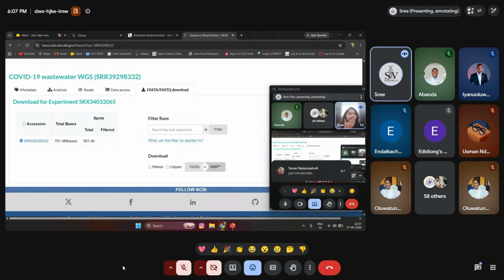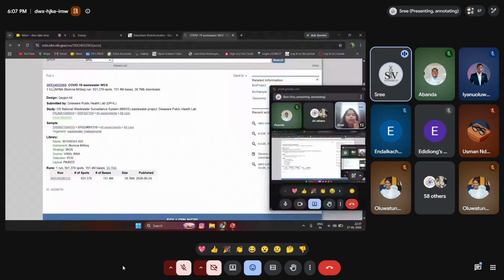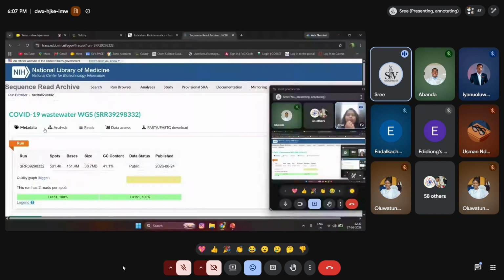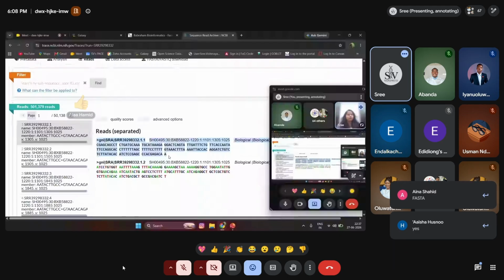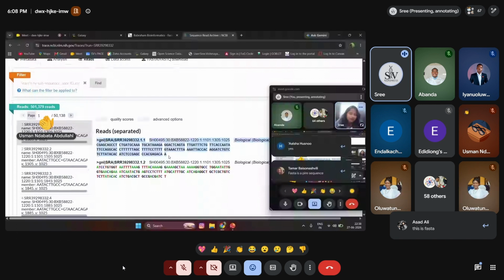This is how you need to check the data. I've just selected one sample, with its sample ID, which is the meta information. In download, this is called SRR. It is also called a sequence ID or accession ID. You can name it anything. If you select this, you can see all the information over here: meta information, analysis, and read information, how the reads look like. So this is how the read looks like, and this is what type of format it is, either a FASTQ file or a FASTA file. You know the difference between both, right? This is absolutely a FASTA file because it starts with a greater than symbol. So this is how the read information of the particular sample looks like.